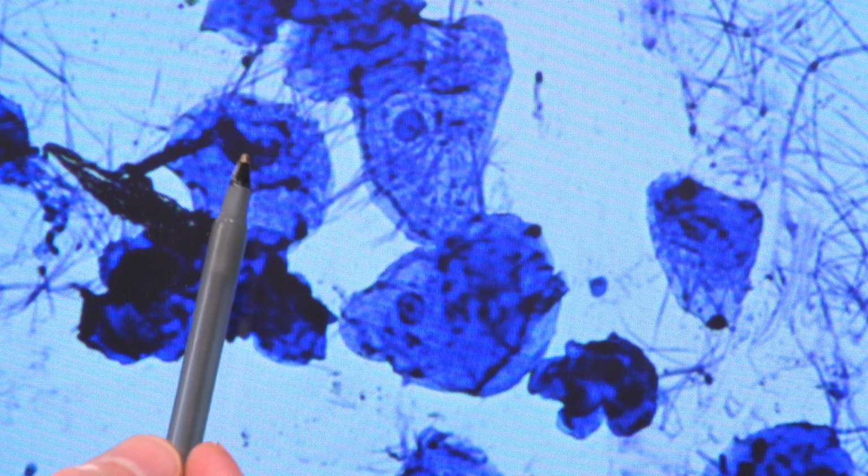Now, this is a particularly bad slide, but sometimes bad slides are very instructive. I've prepared plenty of slides where I didn't have so many fibers, and if the stain didn't stick so well, what we would see essentially is a lot more bacteria. So I'm just kind of hunting around, just like you would do. Looking, a lot of garbage, although it looks cool. And I'm looking for a human cell that will show me some bacteria that are a lot more clear.